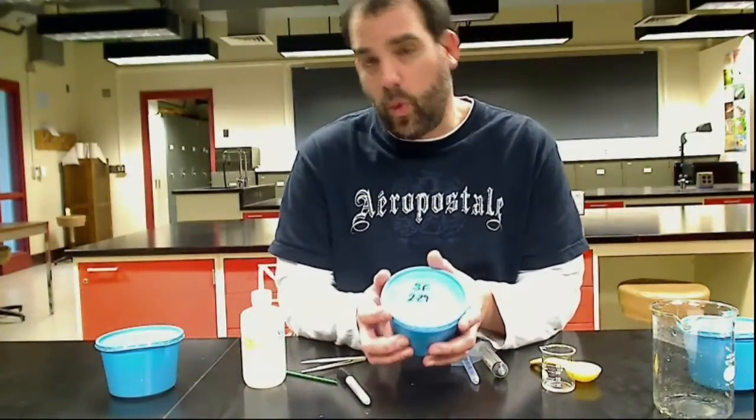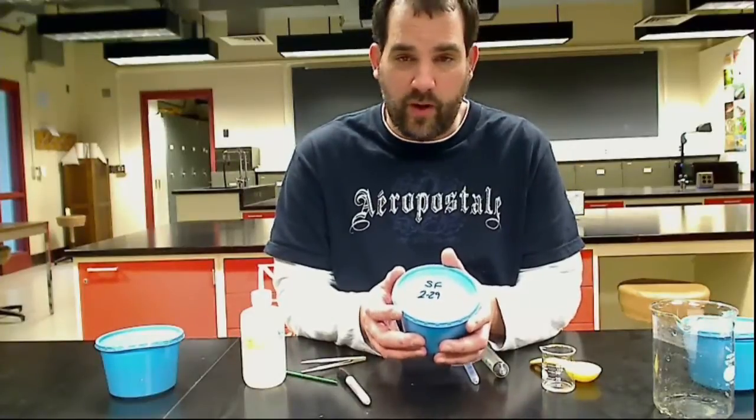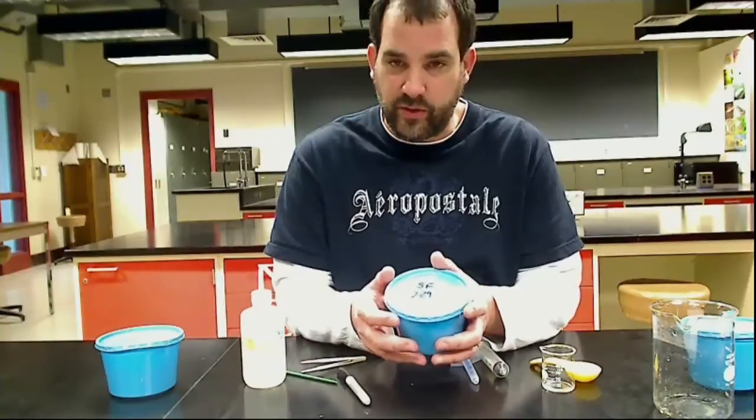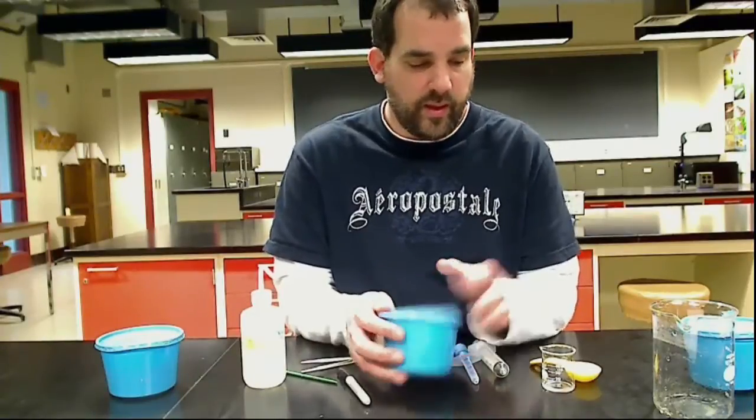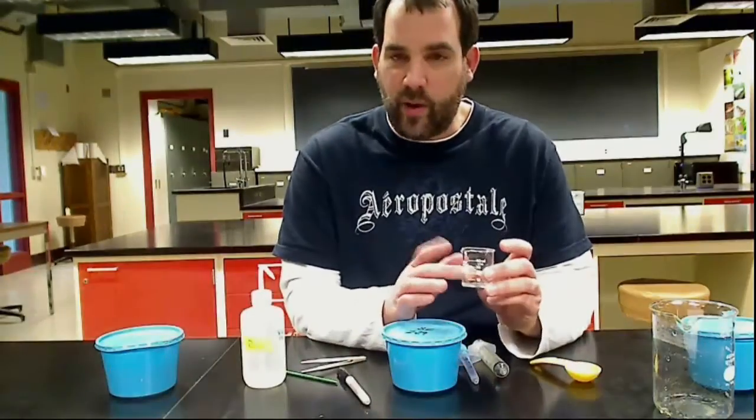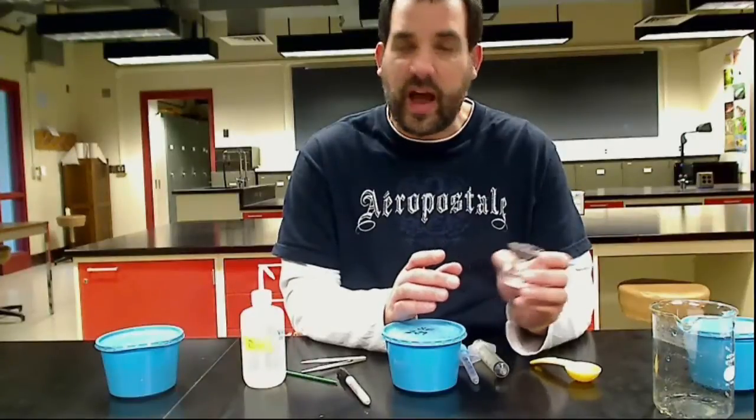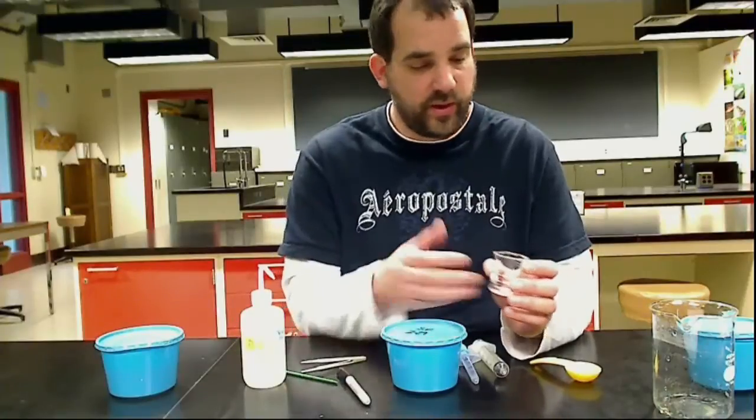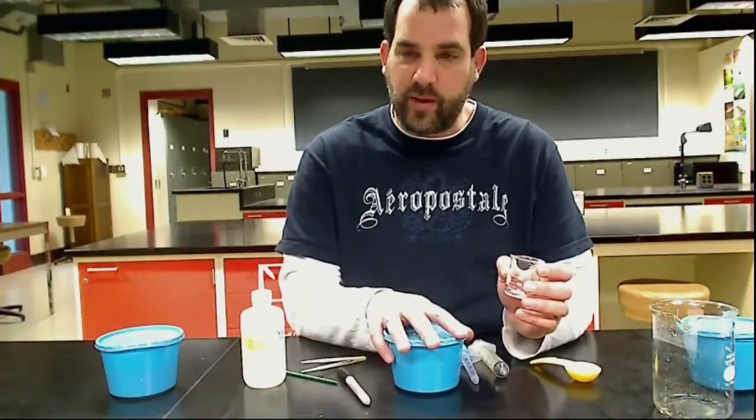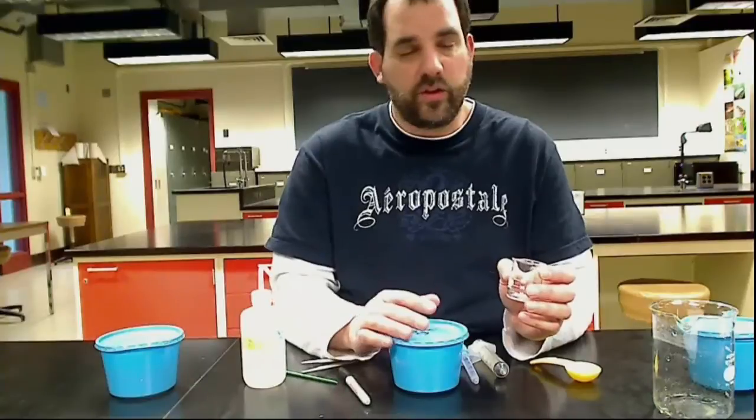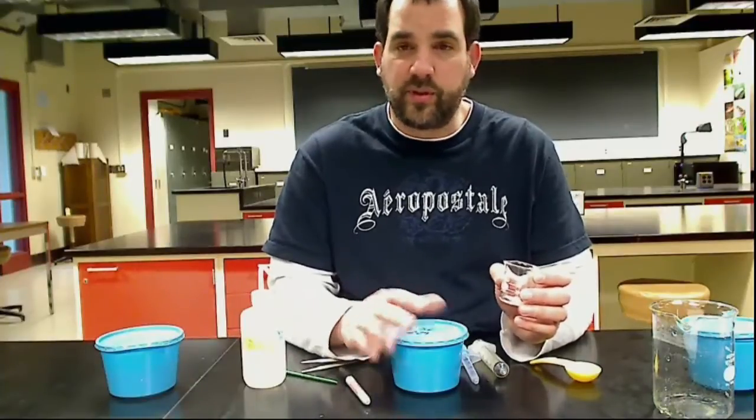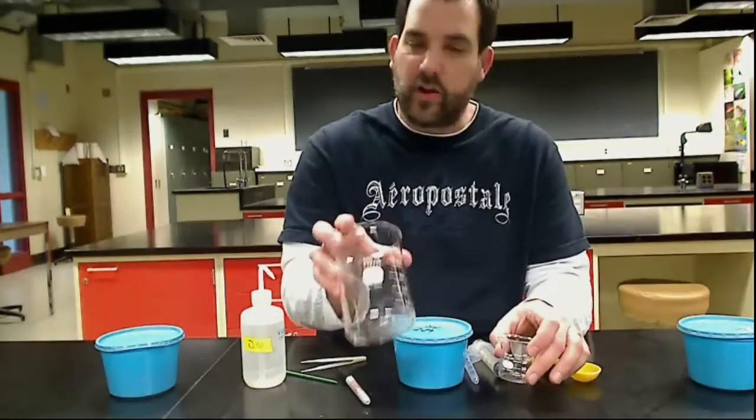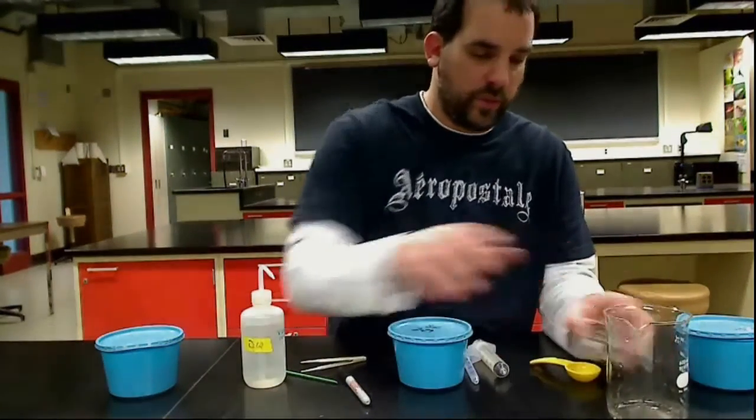Obviously, you're going to have a lot more cups than one. You're going to have anywhere from eight to 40 cups that you're going to want to do for each species, depending on what you decide to do for your farm. That's going to affect the amount of stock that you're going to collect using the IJs that you're getting from the starter cups. So if you're going to be putting on 20 mils per cup, you're just going to multiply it out. If you have 20 cups you need to inoculate, you're going to need 400 mils of liquid.